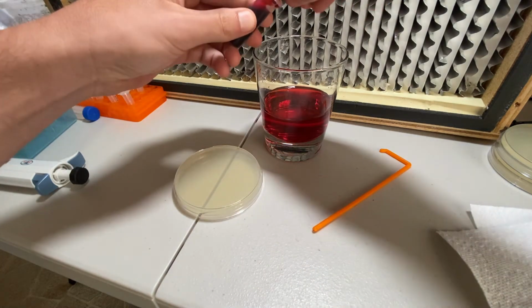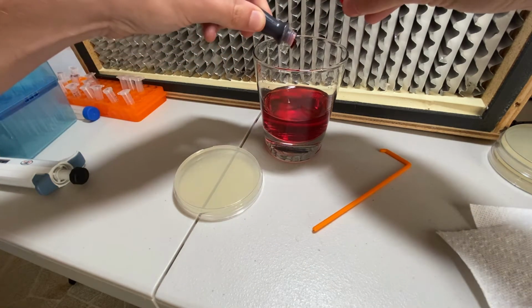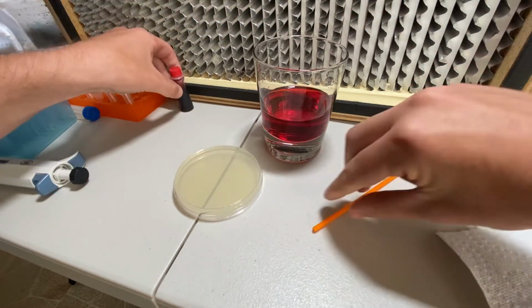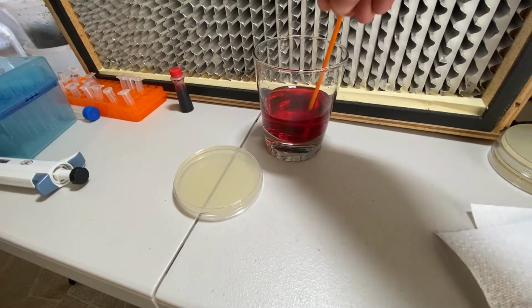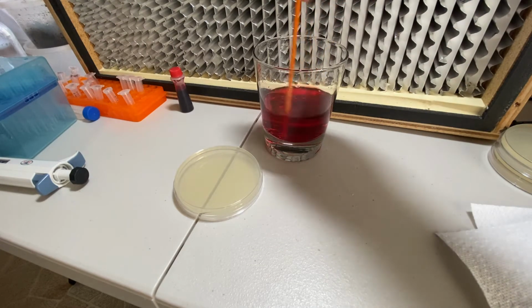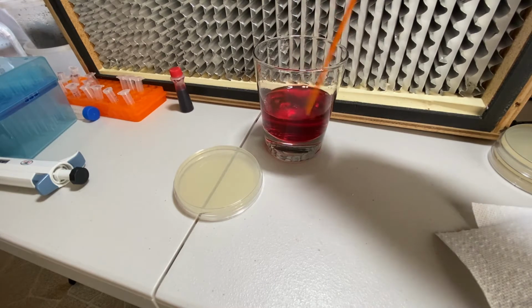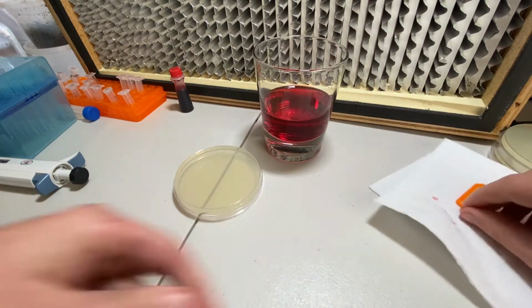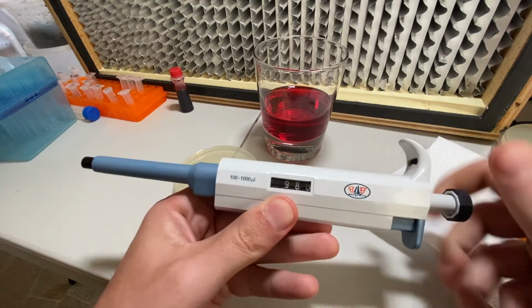So normally I'll put somewhere between 150 and 250 microliters of whatever it is that I'm spreading. I'll put that onto the plate. Now, I think the more that you spread, the easier it is to get it evenly distributed, because there's just more material and more of it can soak in. So I'm going to start with less. I'm actually going to start with the 150 microliters.